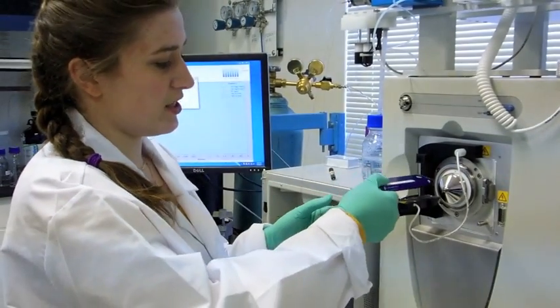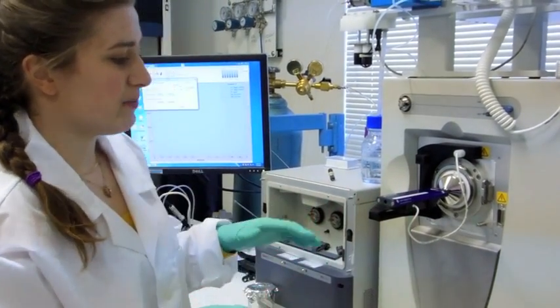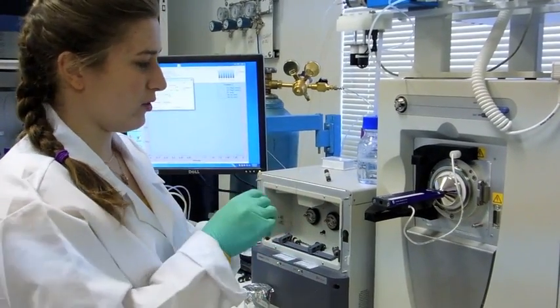To install the Picochip, place it on top of the source. It will slide right into place due to the magnets on the source.